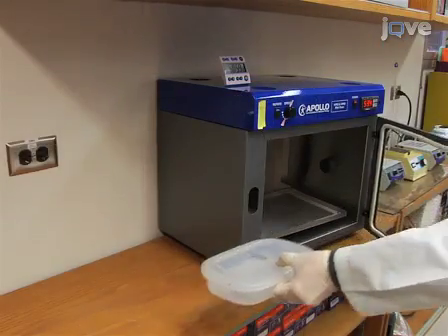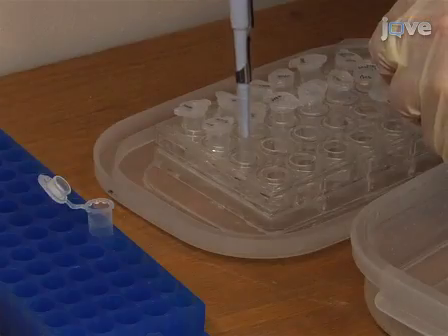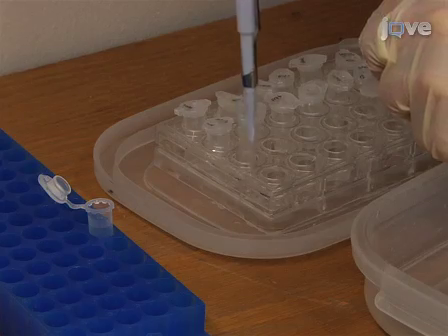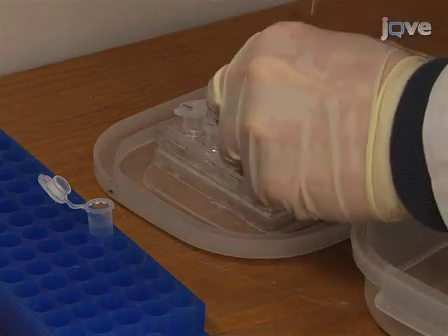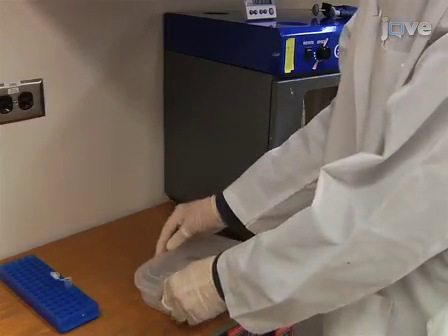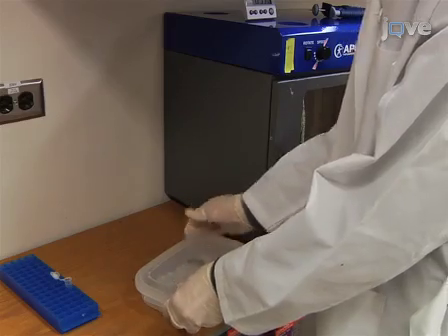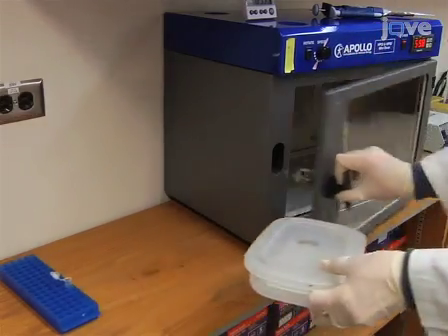Initiate the hybridization by adding 0.5 micrograms of labelled riboprobe to each well. Then continue the incubation overnight inside the heated hybridization chamber.